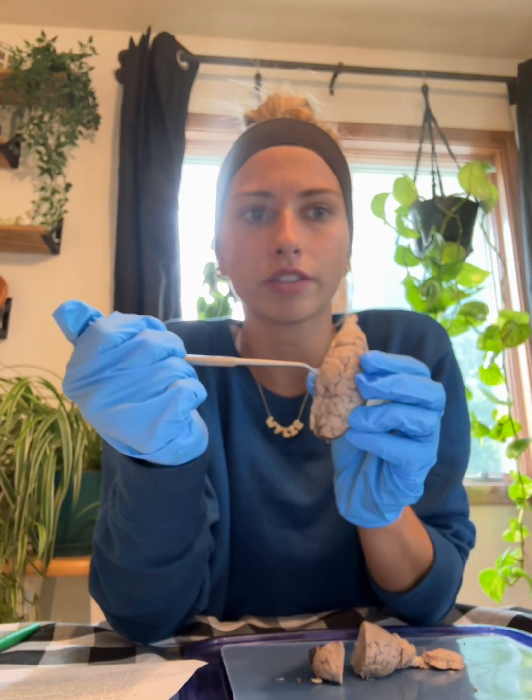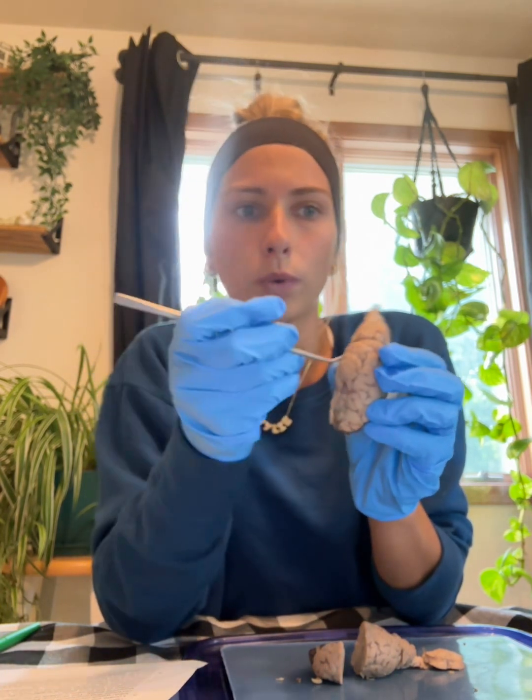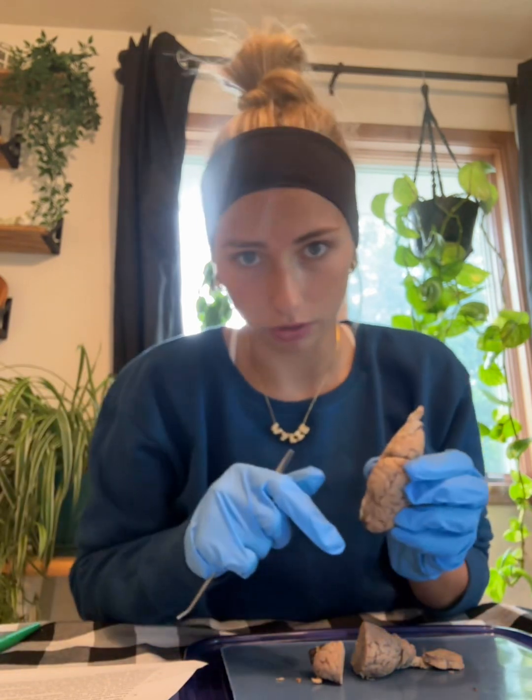The gray matter is in the cerebral cortex of the brain and the inner portion of the spinal cord. Areas of the brain and spinal cord containing cell bodies, dendrites, and axons. While the white matter is just axons within the brain and spinal cord, found in the inner portions of the cerebrum and the outer regions of the spinal cord.